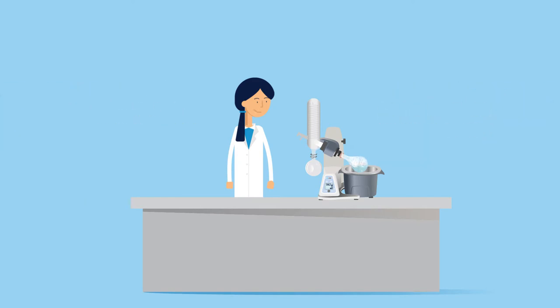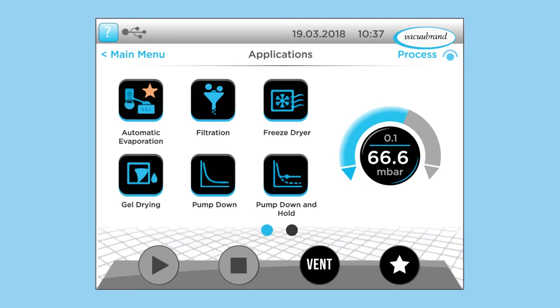You can also use the touchscreen display to program your experimental protocol into the pump to repeat processes exactly and improve the reproducibility of your rotary evaporation experiments.